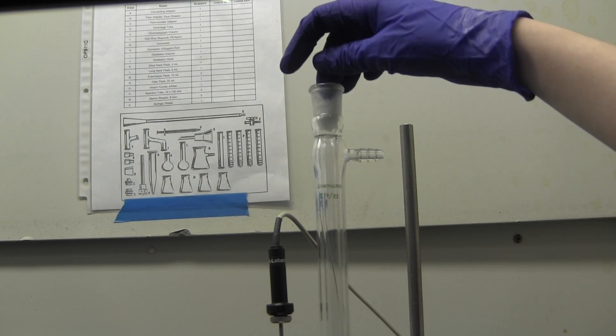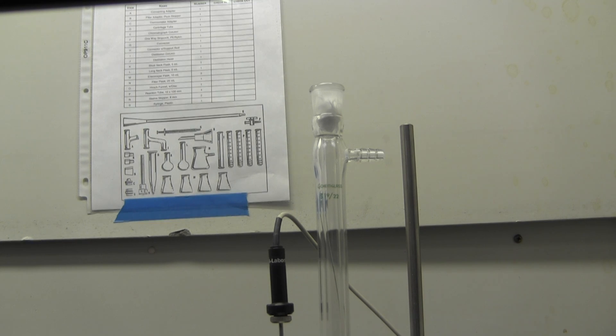After you have flushed the setup, you should not add any solid reagents or detach any part of the setup.